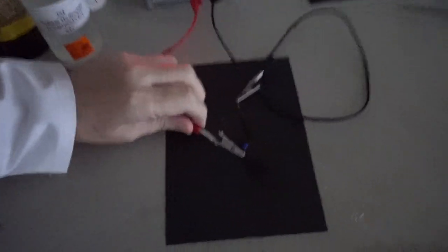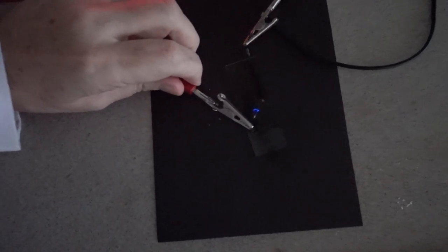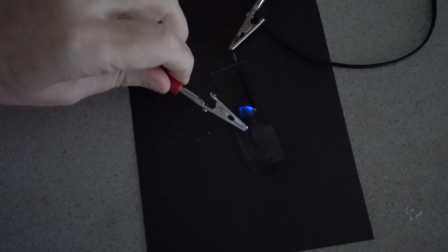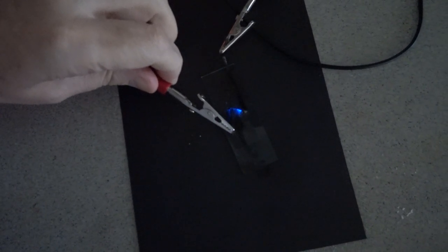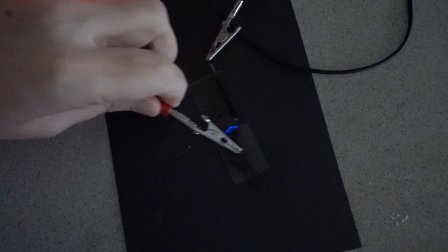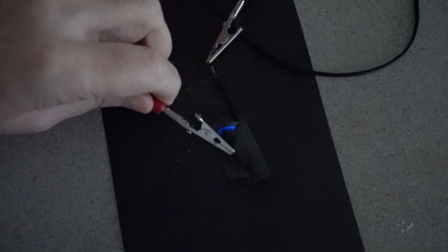If we move the camera slightly closer, you should be able to pick that up—that nice blue color of the luminol reaction under electric current. So that's the electrolysis of a luminol solution.